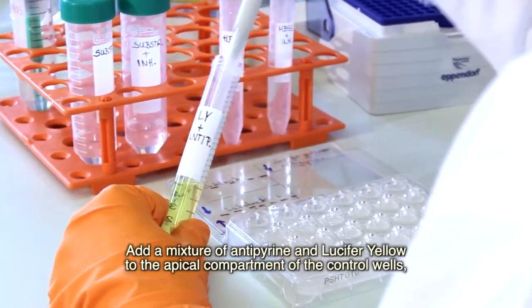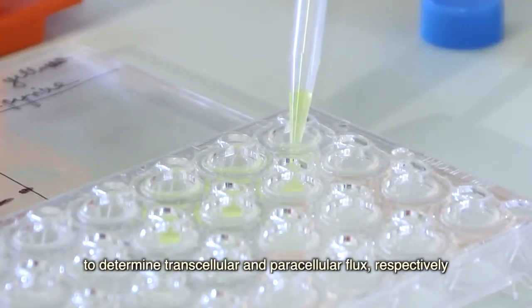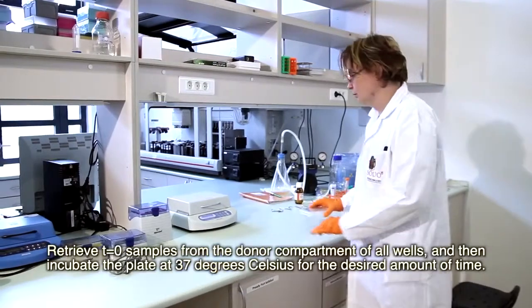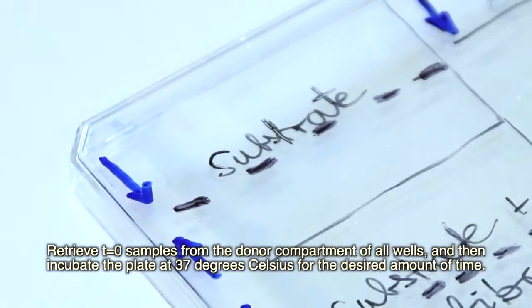Add a mixture of antipyrine and lucifer yellow to the apical compartment of the control wells to determine transcellular and paracellular flux respectively. Fill the basolateral compartments with the appropriate solutions according to the experimental design. Retrieve time zero samples from the donor compartment of all wells and then incubate the plate at 37 degrees Celsius for the desired amount of time.